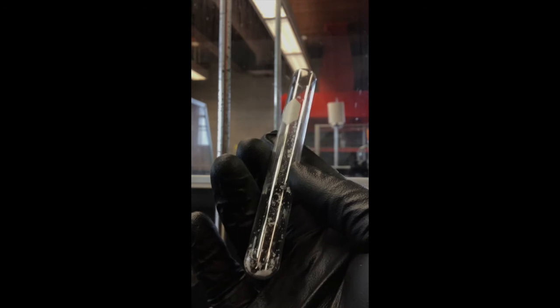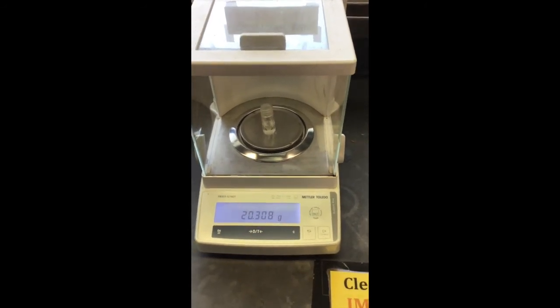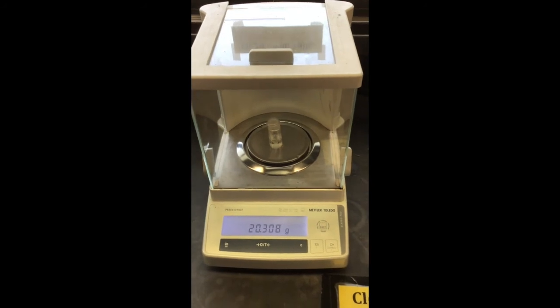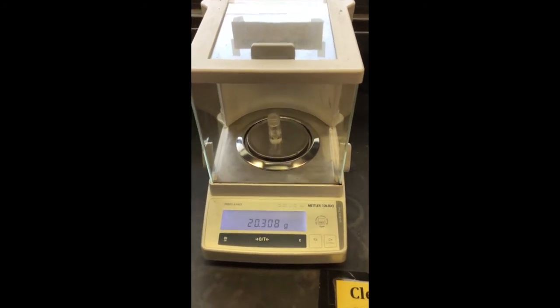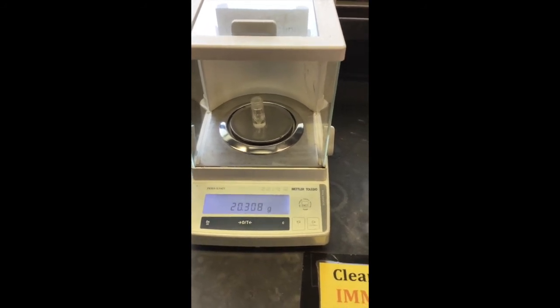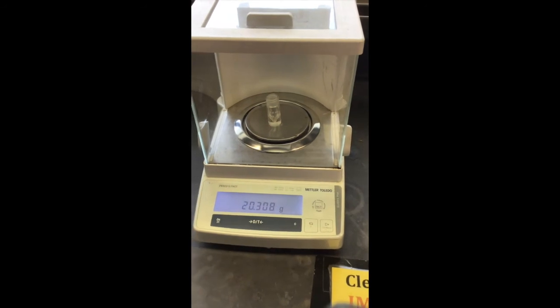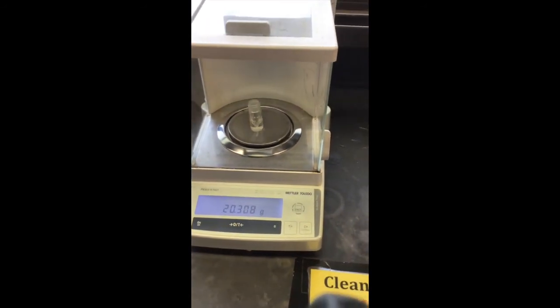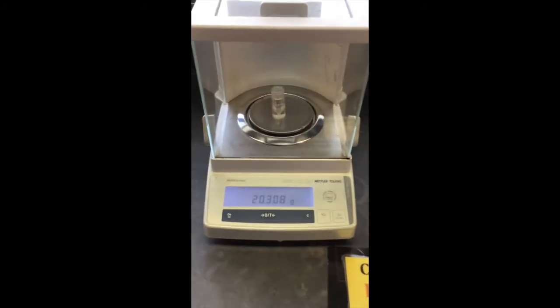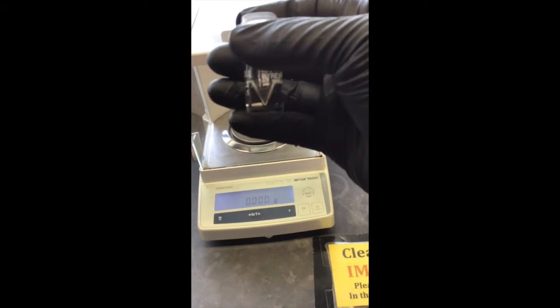We'll still weigh out the mass of the succinic acid vial — there's no obvious solid, though there does seem to be something that doesn't look like sodium sulfate. This is the vial where the succinic acid and methylene chloride should have been, and it reads 20.308 grams. Compare that to the original vial mass for the succinic acid extraction — any difference would be the mass of succinic acid. Given no visible solid, any negligible difference could just be error, like a water droplet, fingerprint, or dust.